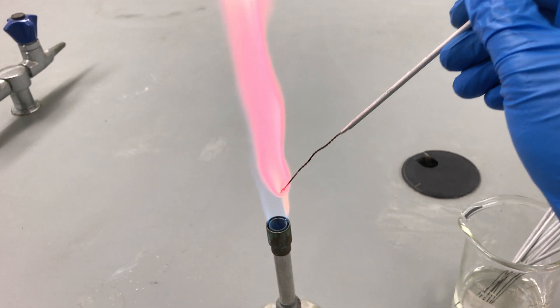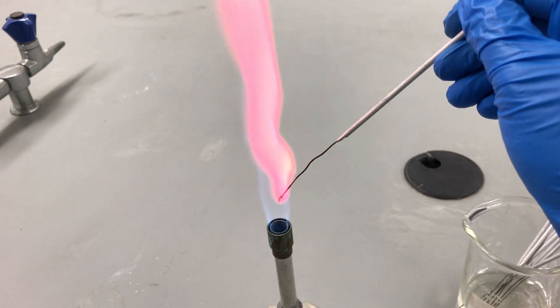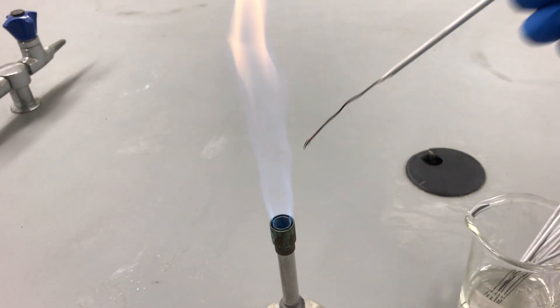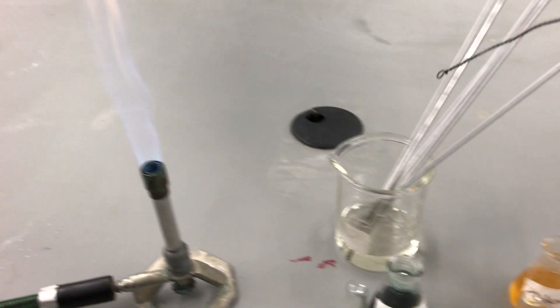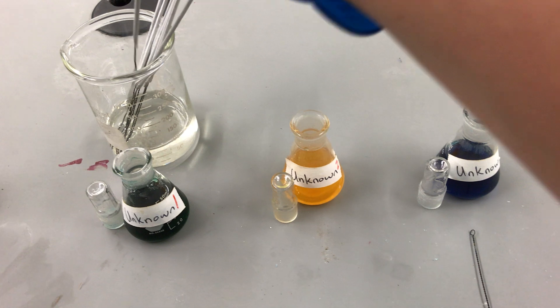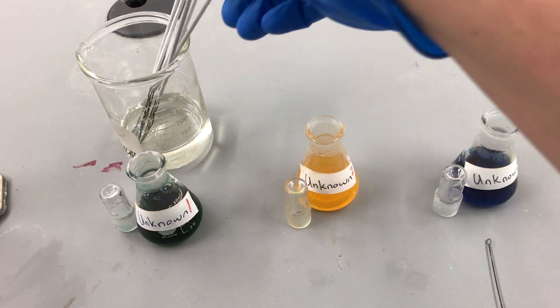A reddish purple, as you can see. From that test we should also be able to identify unknown two by matching it to one of our knowns.